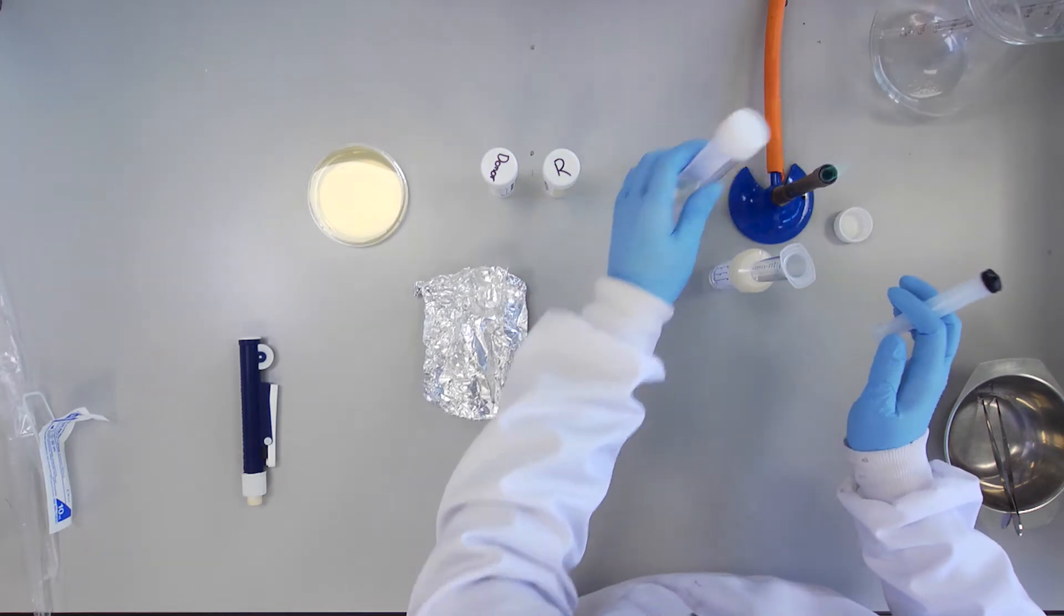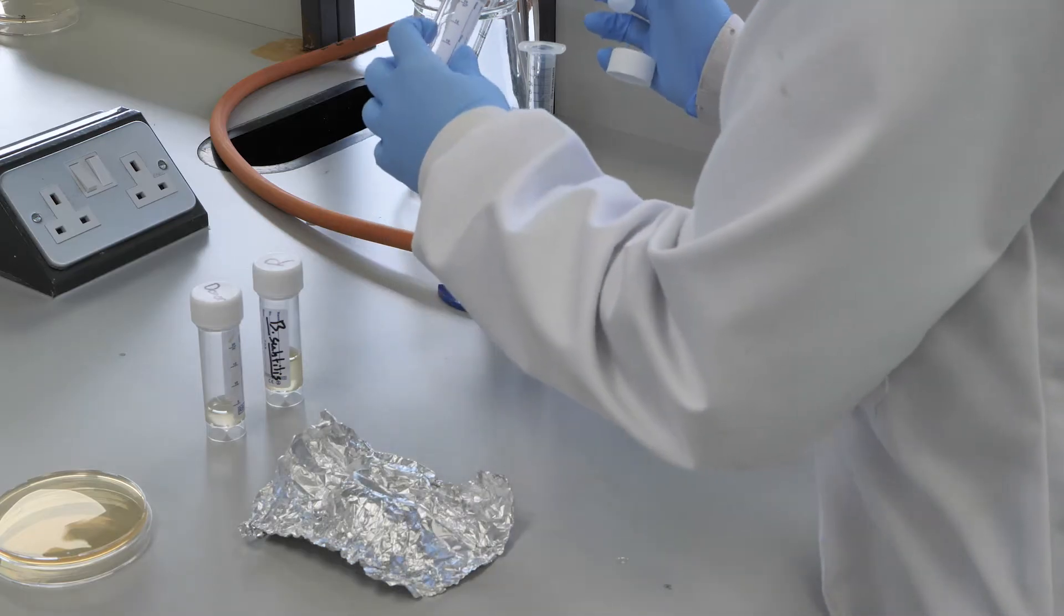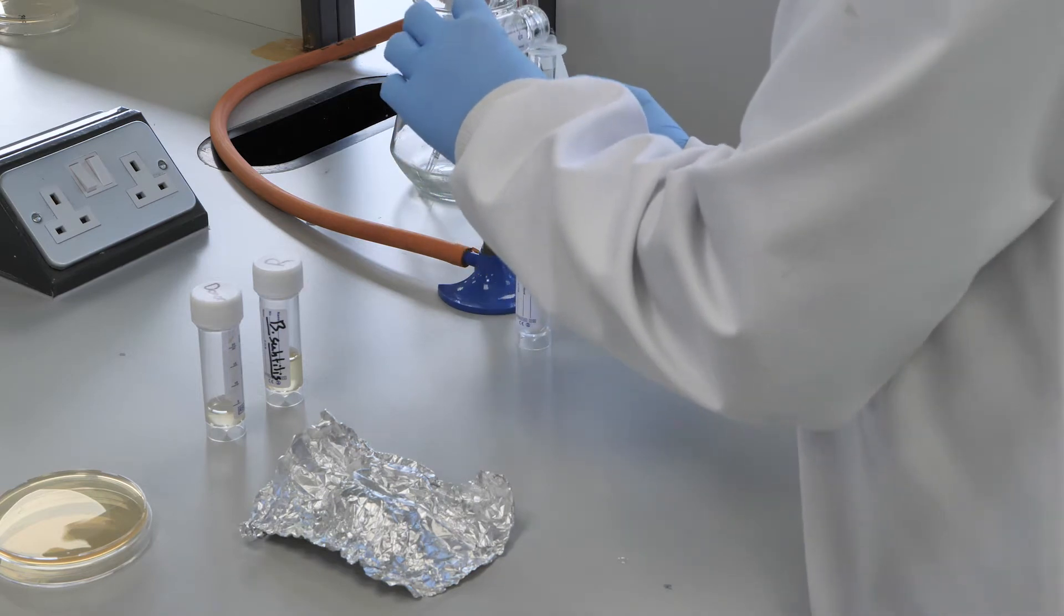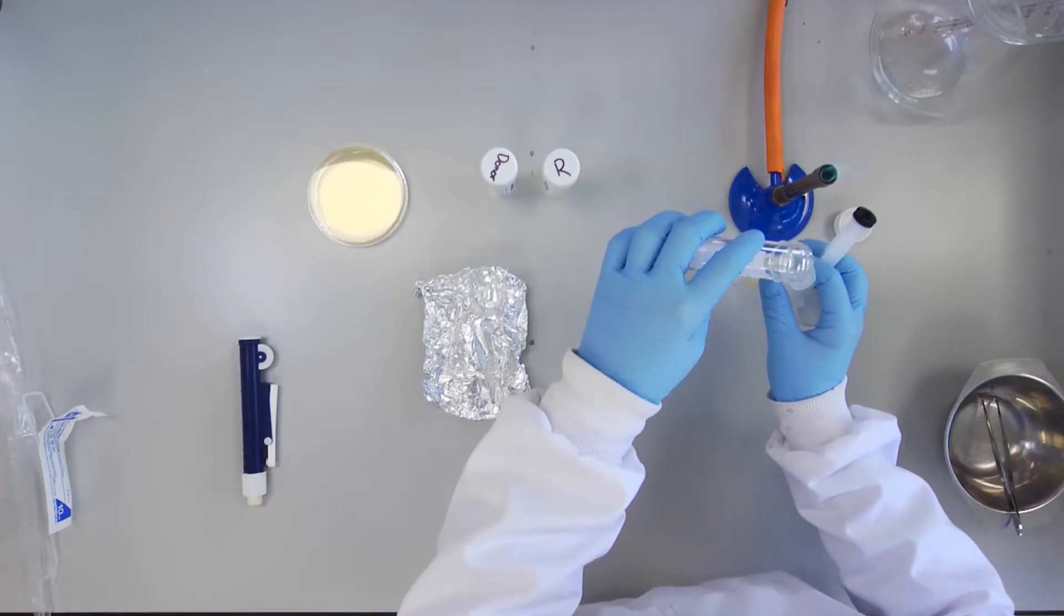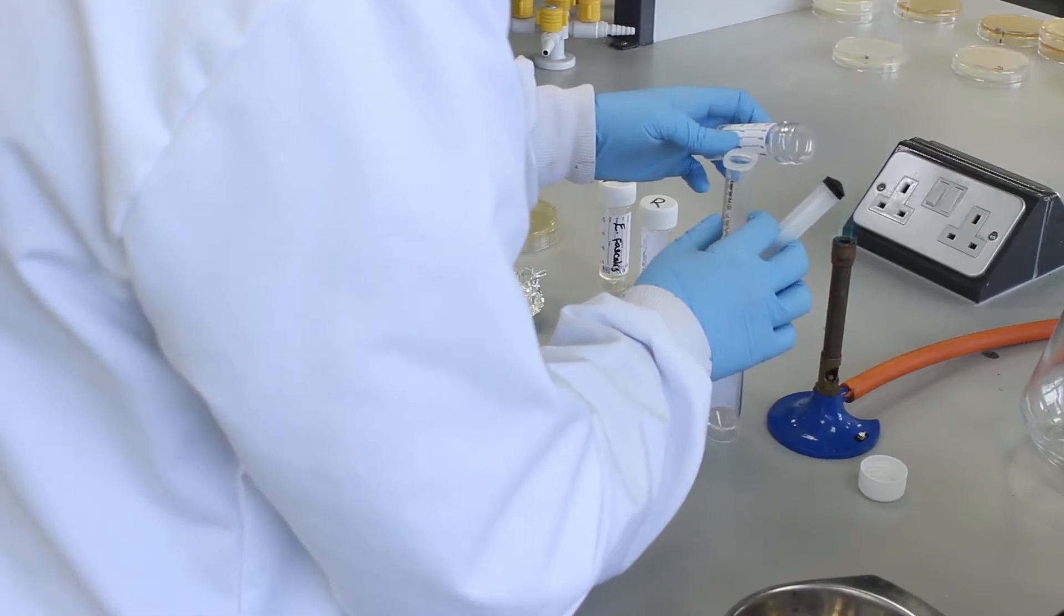One milliliter of donor and one milliliter of recipient is added into the syringe. Replace the plunger.